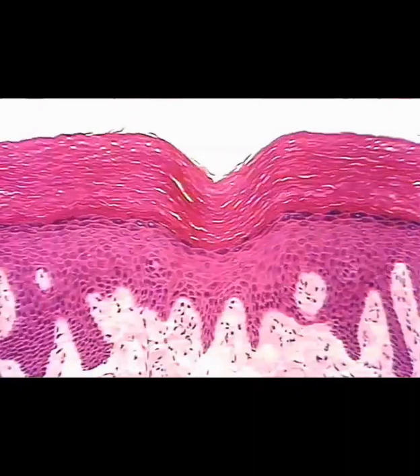The next slide is the skin, and at the top layer of the skin, we are looking at stratified squamous epithelial tissue that is keratinized. So keratinized means that very top layer is dead. Underneath that top layer, there are living cells, but when you're looking for stratified squamous epithelial that's keratinized, you're only going to be identifying that top layer of cells.